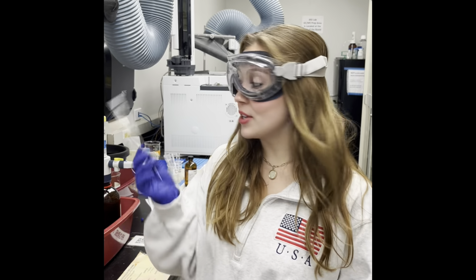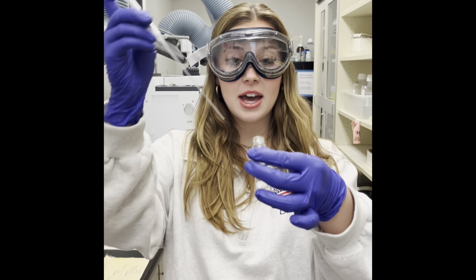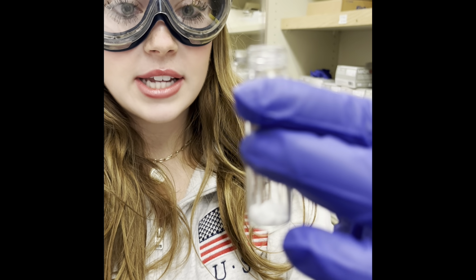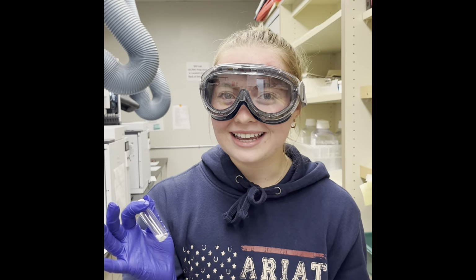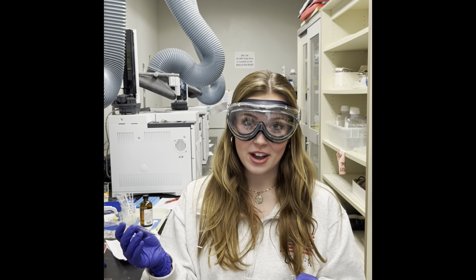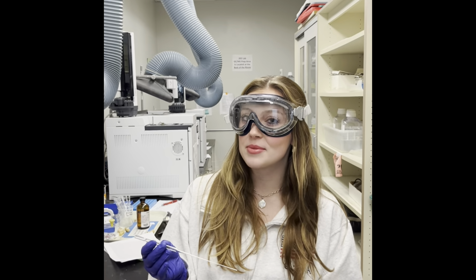First thing you want to do is grab one of these glass pipettes from the yellow bin. The next thing you're going to want to do is go ahead and place that glass pipette into your vial like this and gently move it around to take up some of your sample. What happens if it looks like I don't have enough sample, even after I've scraped the vial? That's totally fine. To run a CNMR or an HNMR, you don't need that much sample, just a few specks.